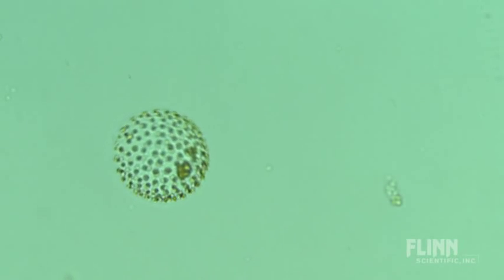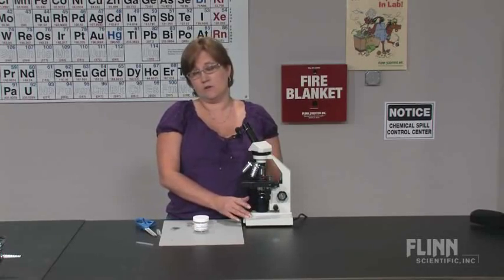You may want the students to actually turn up the light once they've found and observed the volvox for a longer period of time, so that the adult volvox or the full-size volvox breaks open and releases the daughters.